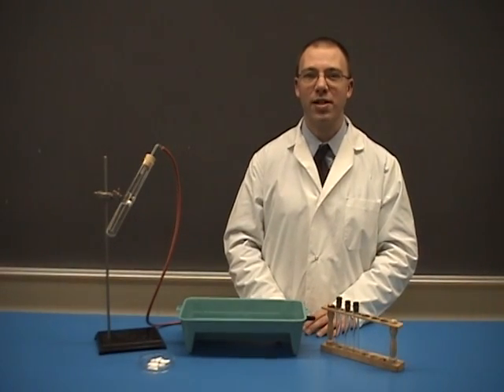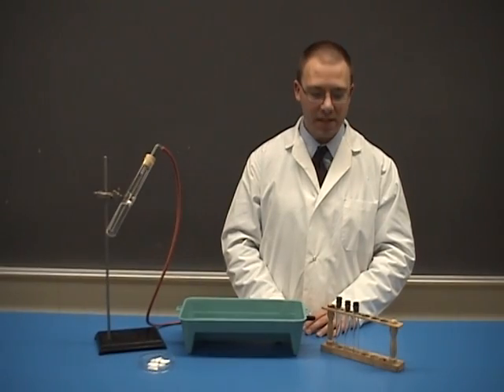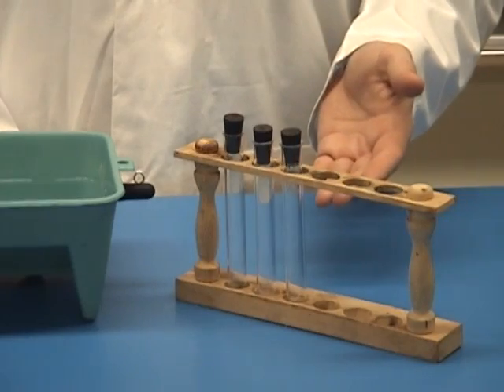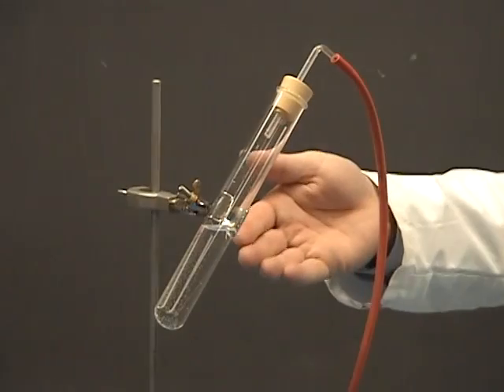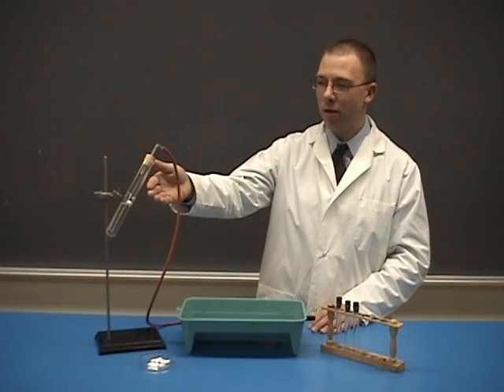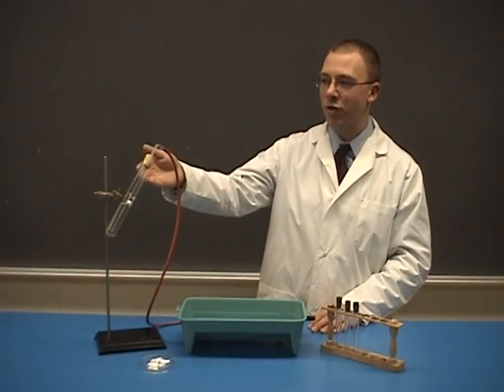The materials that you'll need for this lab are three small test tubes, a larger test tube filled with water, supported by a universal support stand.